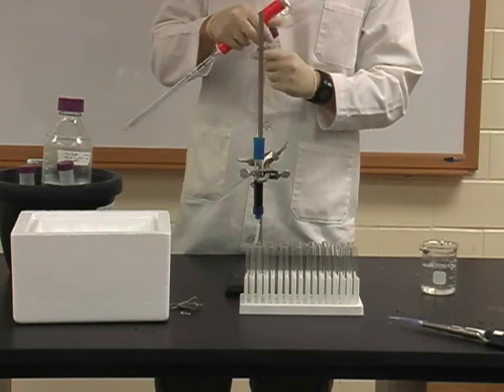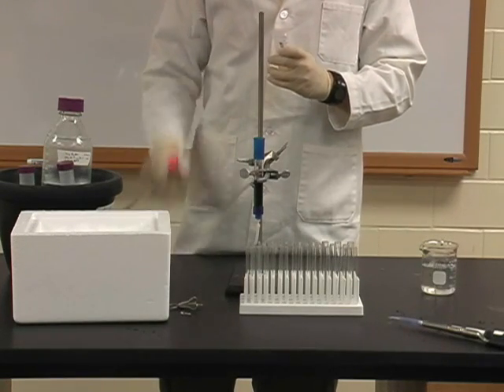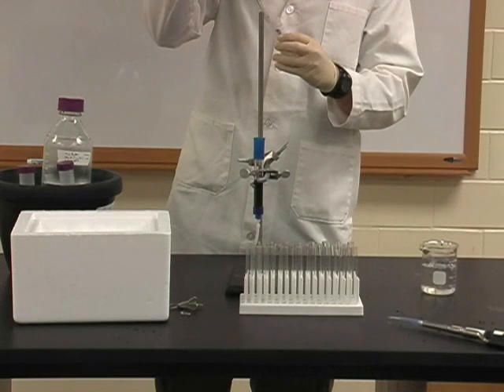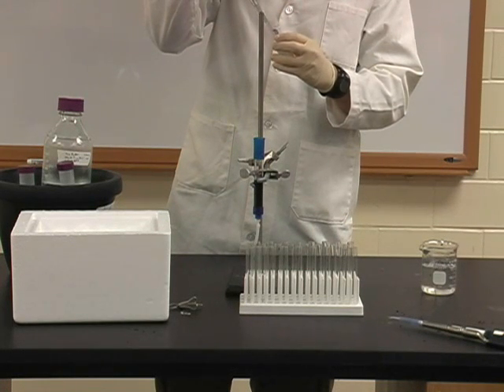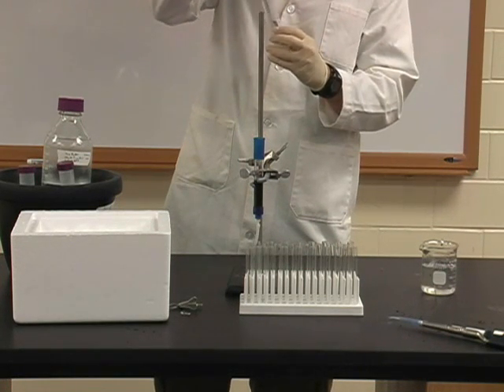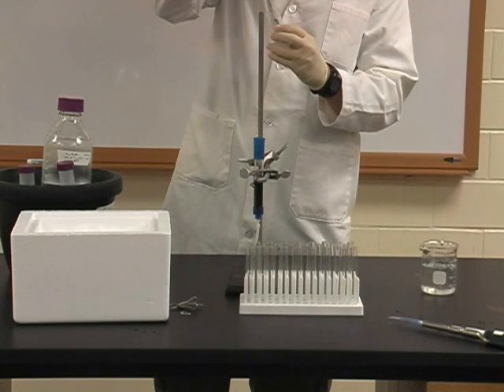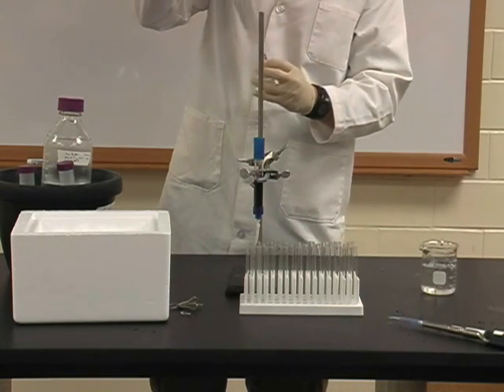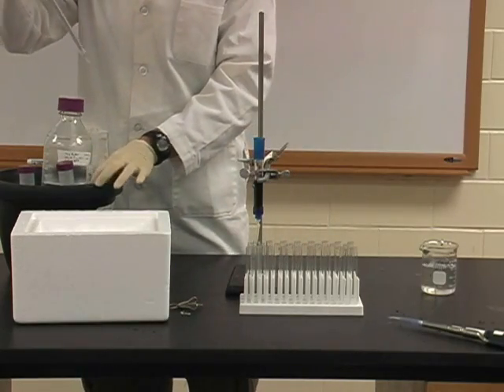Here 10 mL of sample is being added to the top of the column, being careful not to disturb too much of the resin at the top of the column. The important thing to note is your sample volume will be completely different depending on how much volume was used to bring up your sample after the desalting. Make sure to record this volume.